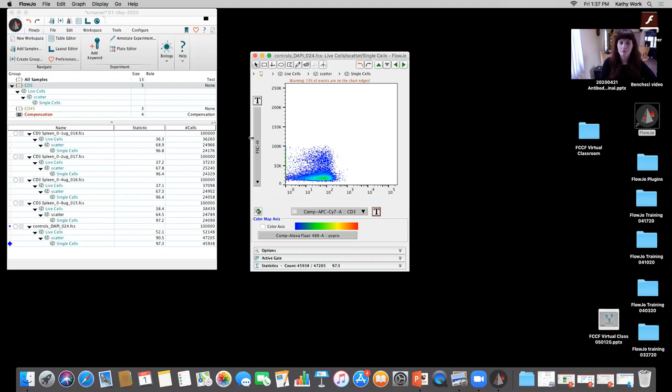Yeah, and another quick reminder is that if we look back to that CytoFLEX data that we just showed, you can easily change where everything falls, just like Rui said, based off of how you set the gain or how you set the voltage, depending on which instrument you're on. So you can easily pull up and show some big differences there. And actually that will make sense for the next data set I bring in, which shows that it's hard to determine sometimes, without an appropriate scatter gate, the right statistics.